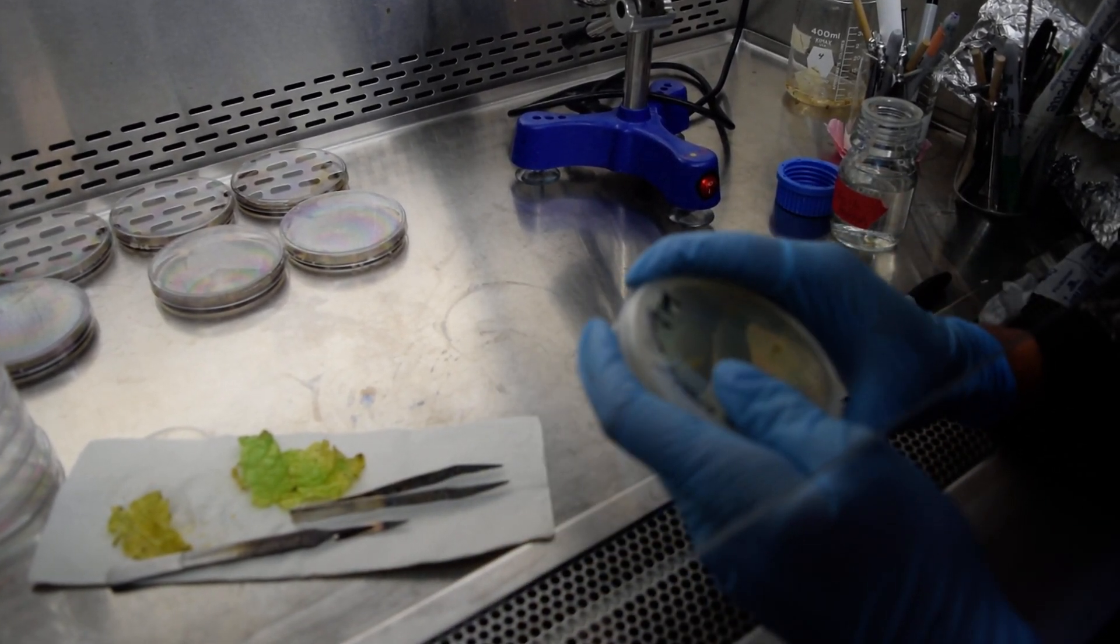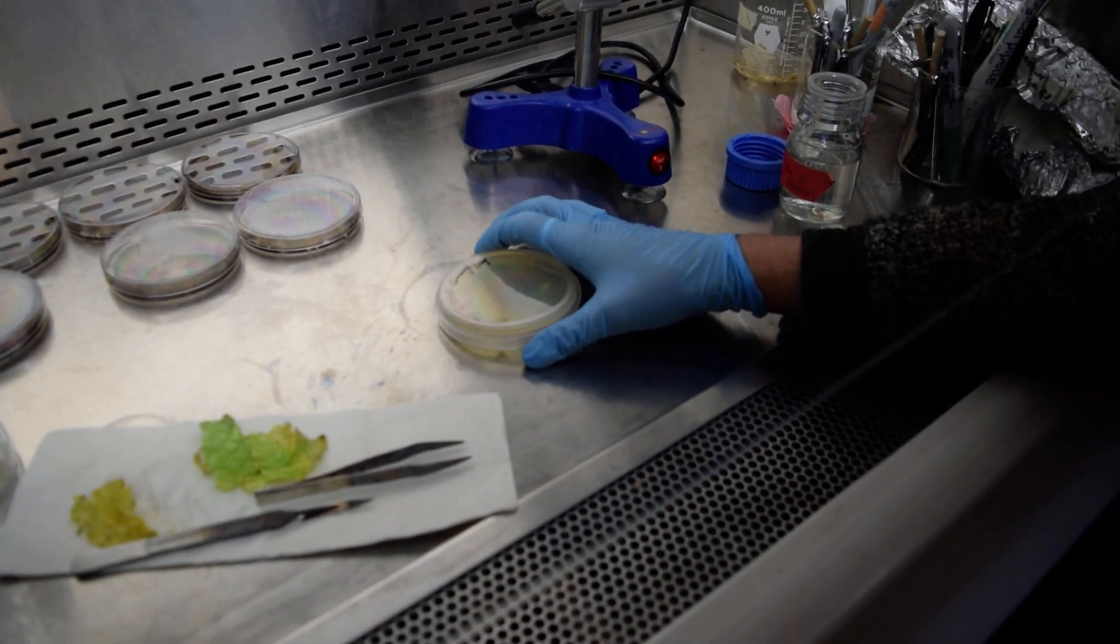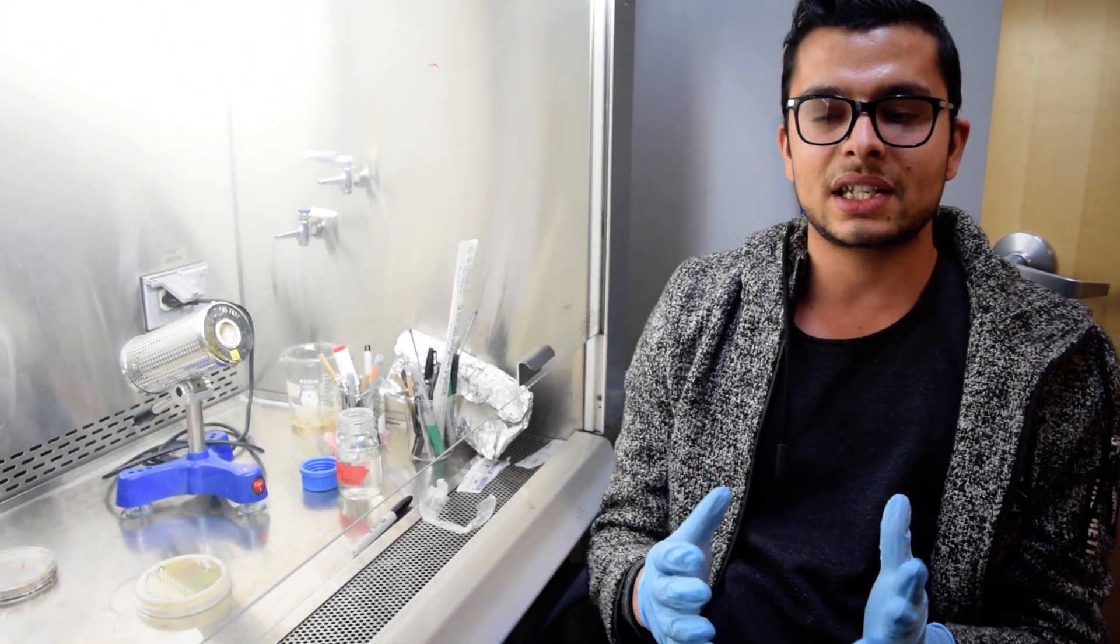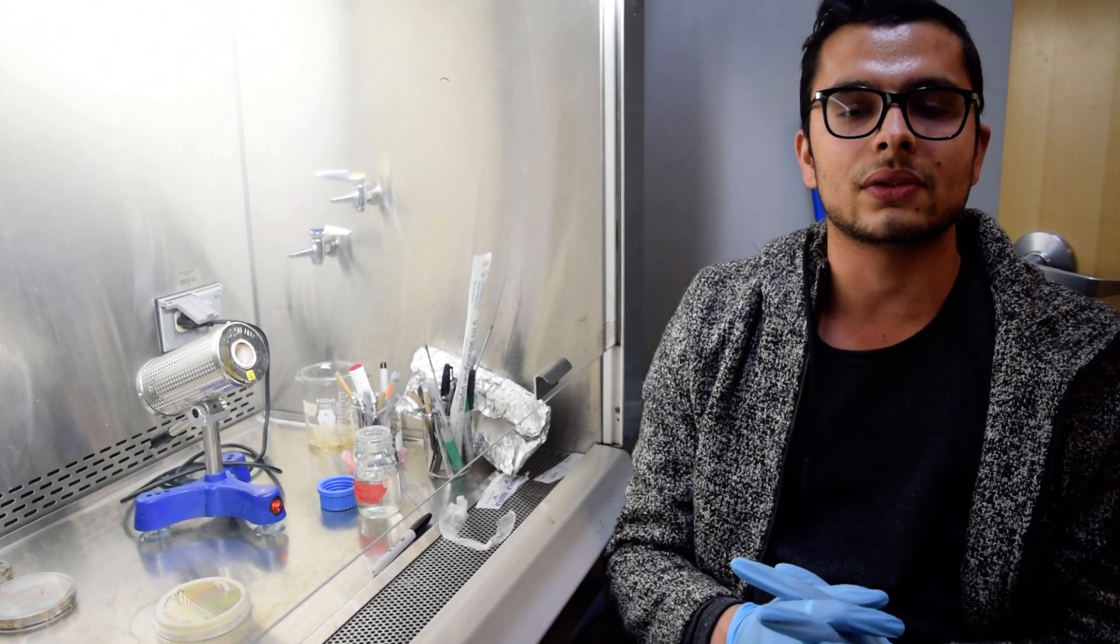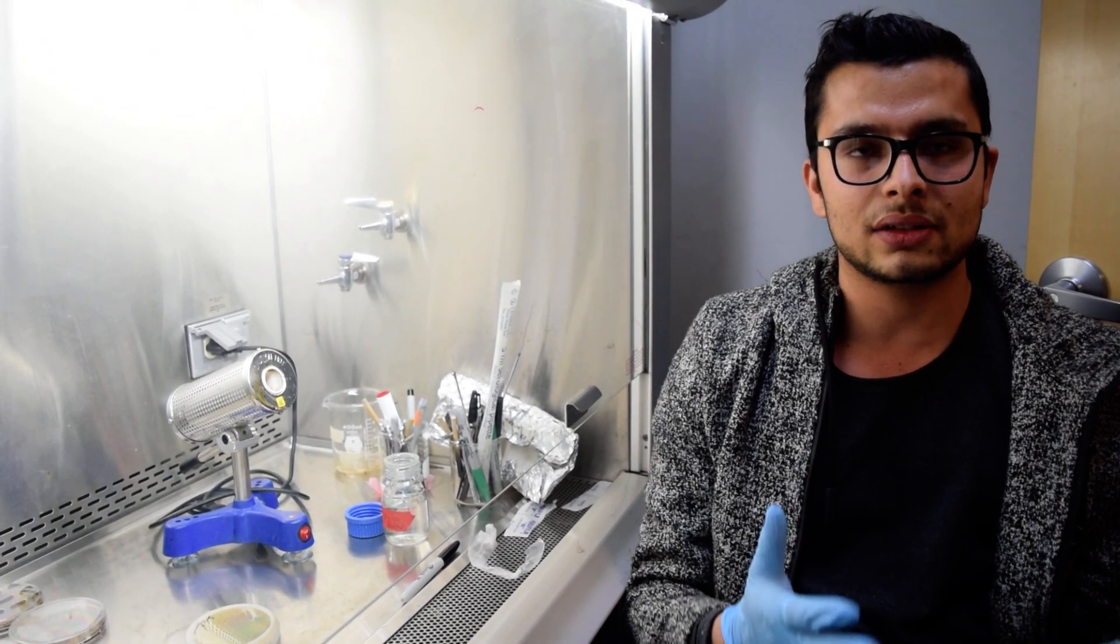We leave it for incubation for three to four days. The disease-causing organism starts to grow in the media.